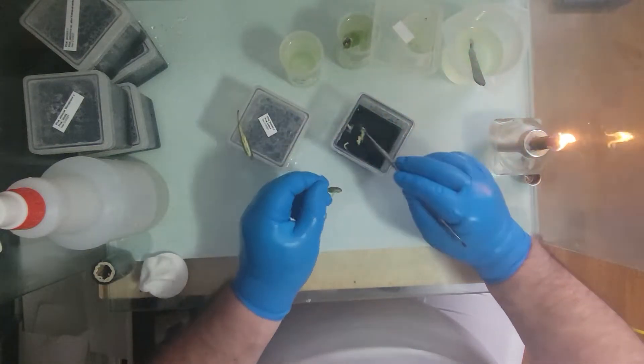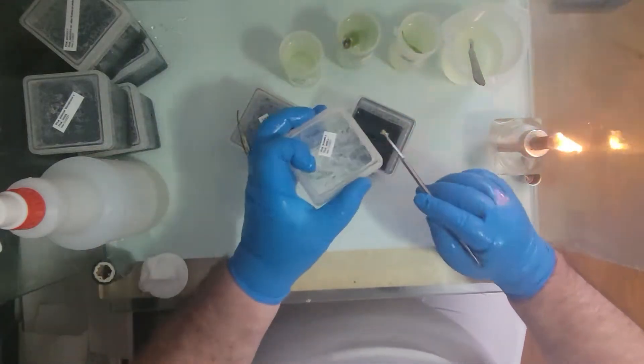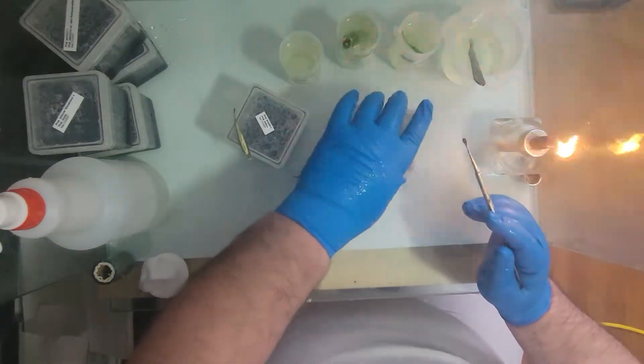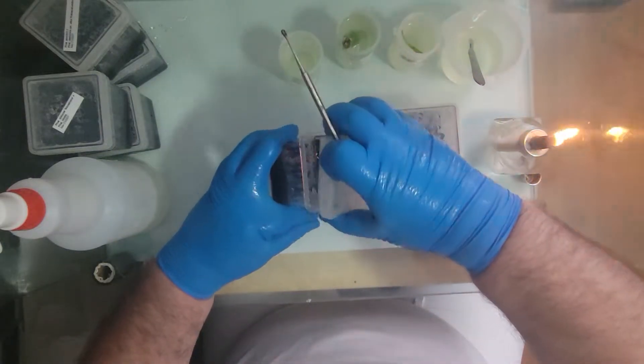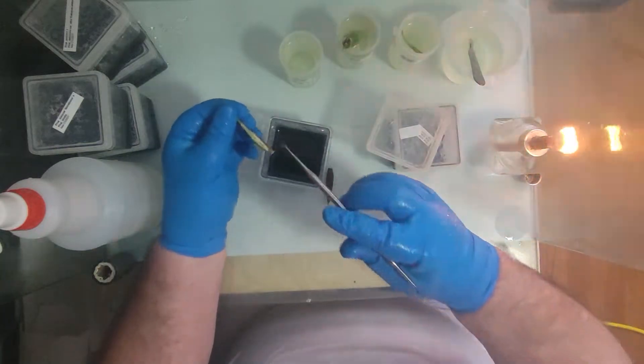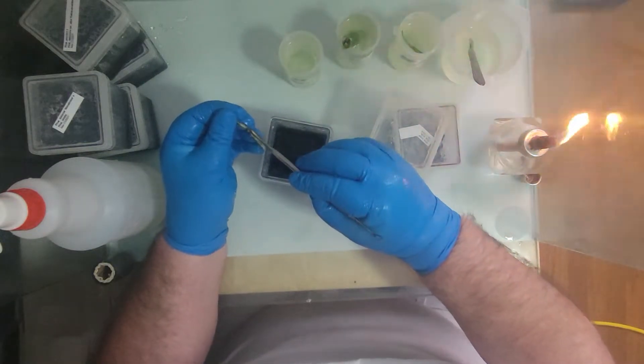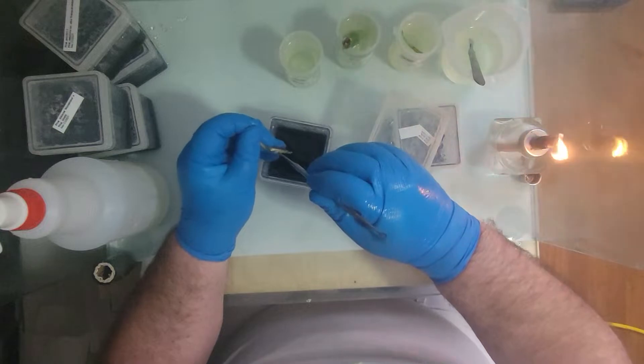As you can see, the spoon scraper. I'm going to put one half in each flask. This is just if I do get contamination, I am able to have one flask instead. Just increasing the odds.